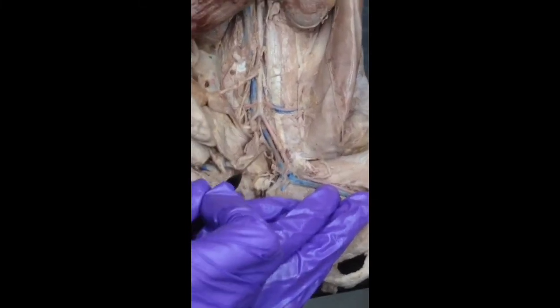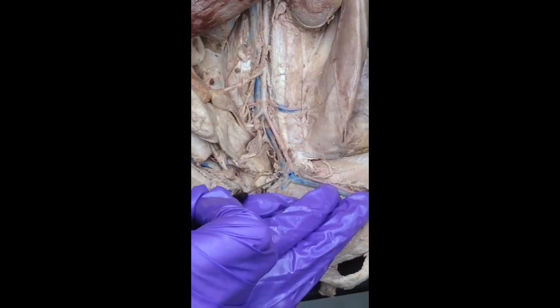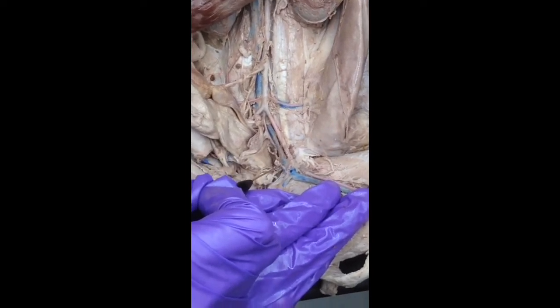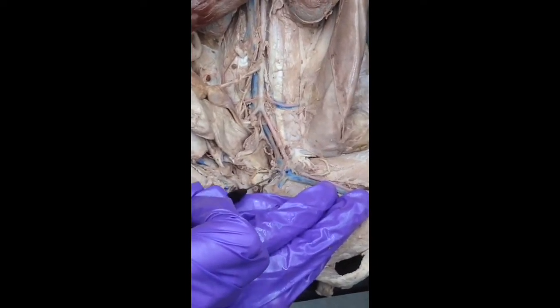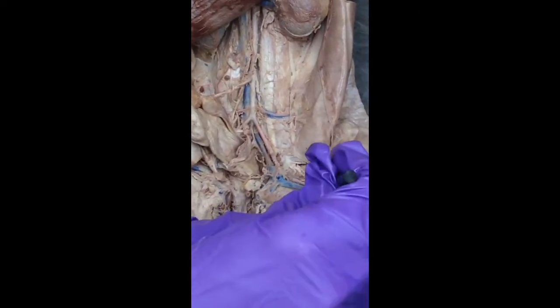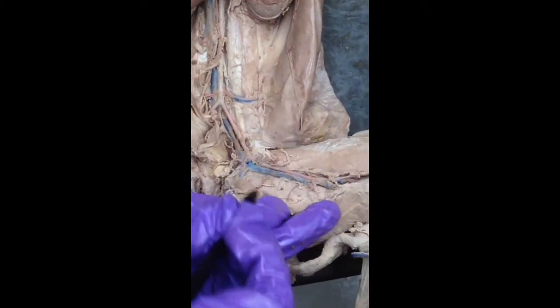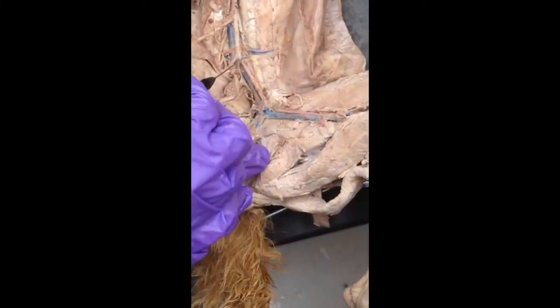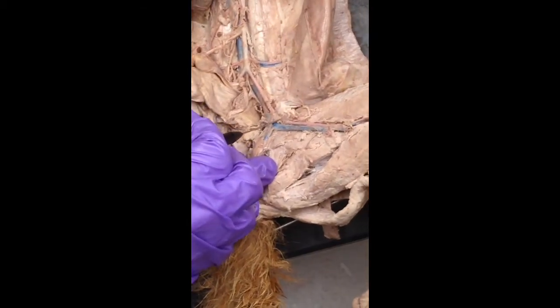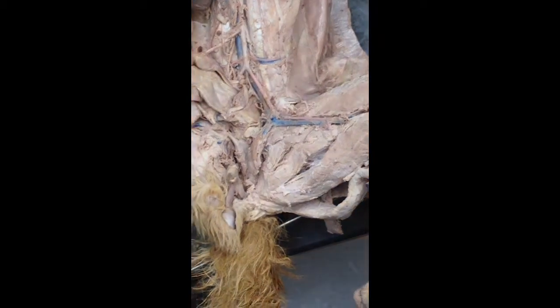So after this first branch, coming down here, we've got this split there, and we follow it down. So this is all common iliac vein, first split, external iliac vein. And then once you run to the next one, and we'll probably pin it down there, now you're in the femoral vein. Now in the artery, it's all external iliac artery, and then it's all femoral artery. So there's an extra thing within the veins down there.